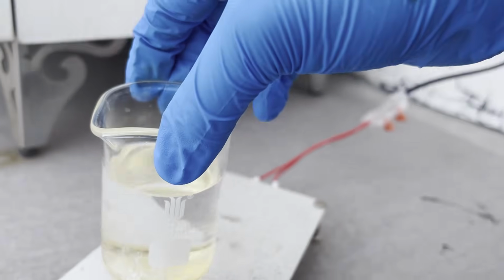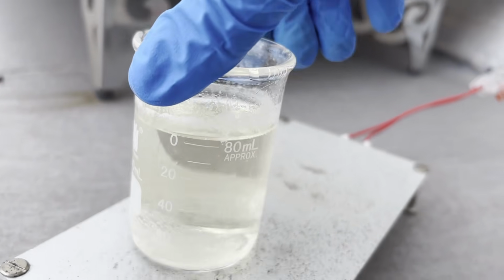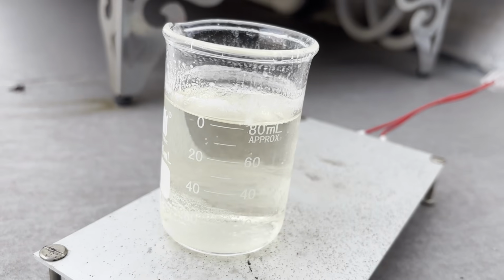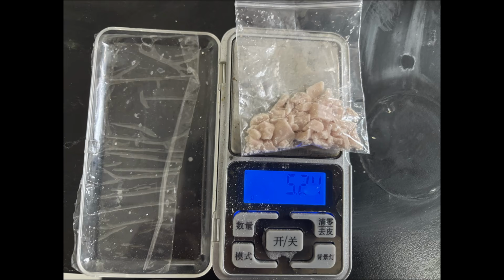This is probably my last chance to realize that my product might be crashing out right now. But I didn't, and proceeded to allow all of it to dissolve in heptane, and waited for it to precipitate out again when I cooled the solution. And it didn't. I just ended up boiling the heptane dry, and I was left with 5.24 grams of slightly pinkish solid.